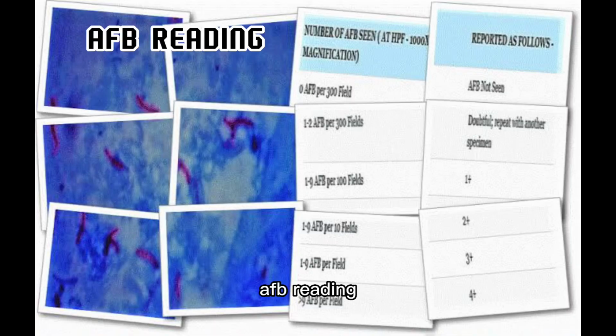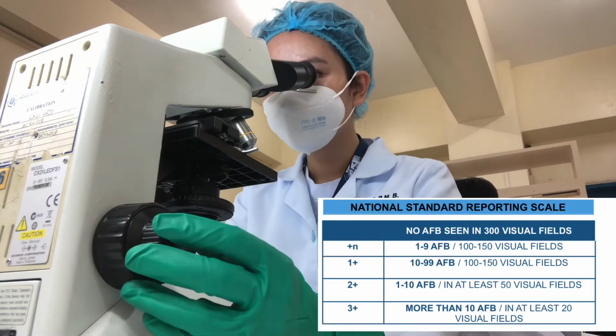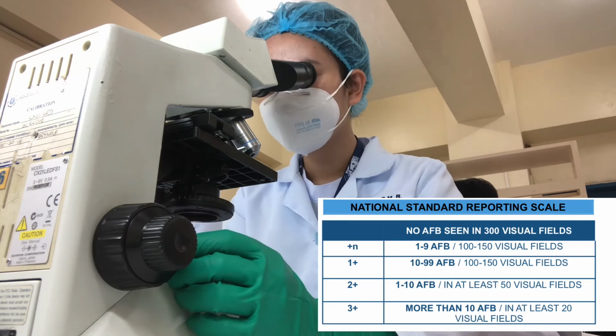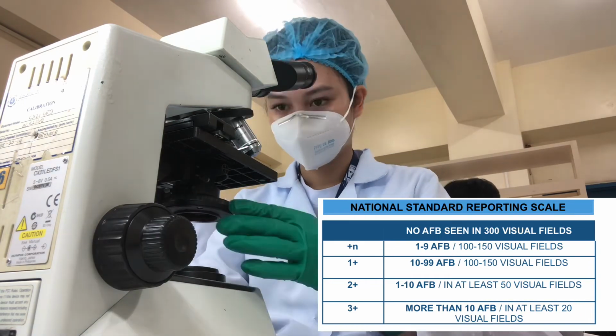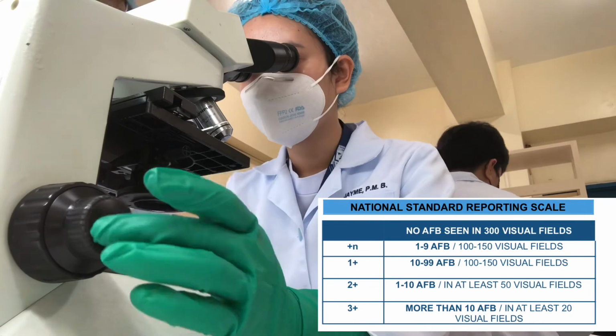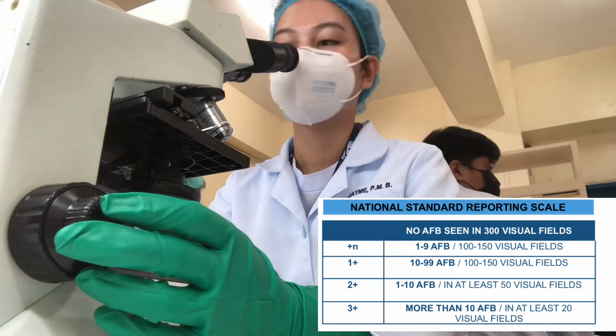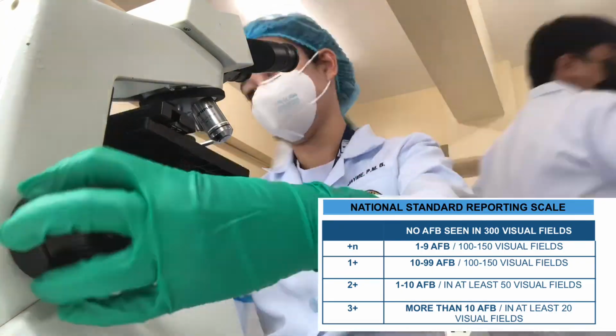AFB reading. For AFB reporting, grading is 0 when no AFB is seen in 300 visual fields. Plus N if 1 to 9 AFB in 100 visual fields, for example plus 1 or plus 2 depending on how many AFB are counted. 1 plus if 10 to 99 AFB in 100 visual fields. 2 plus if 1 to 10 AFB per OIF in at least 50 visual fields. 3 plus if more than 10 AFB per OIF in at least 20 visual fields.